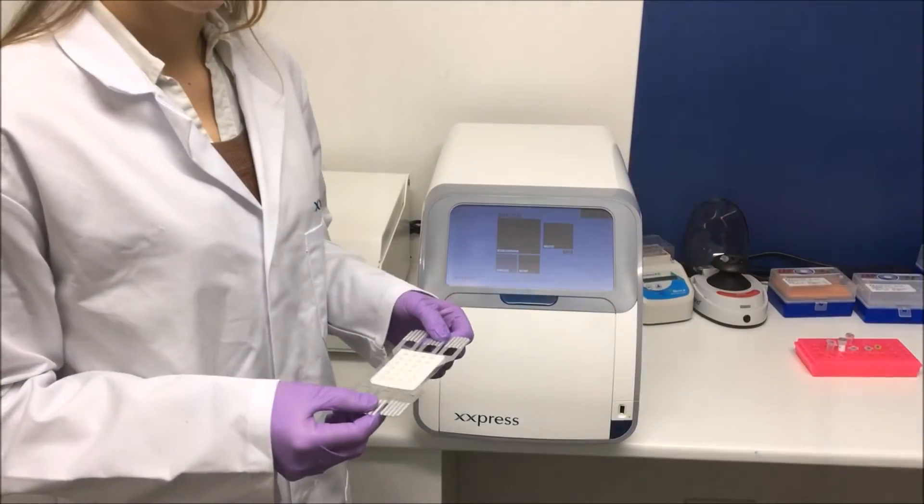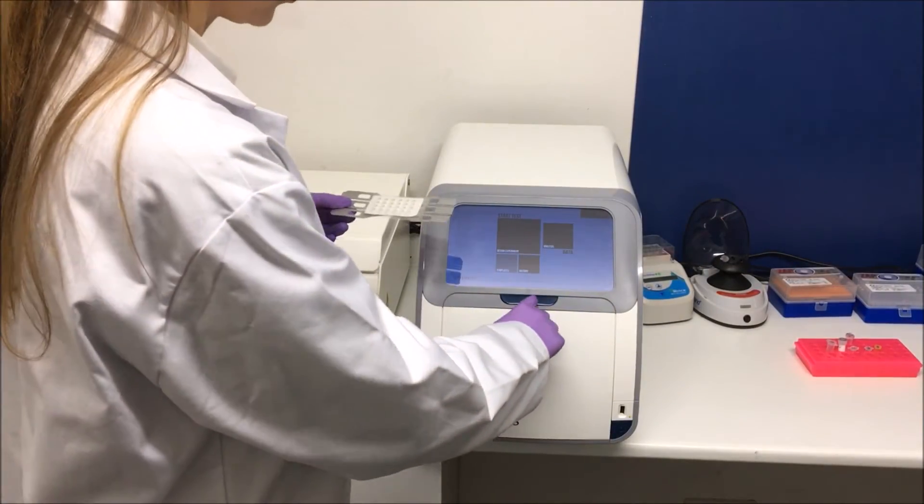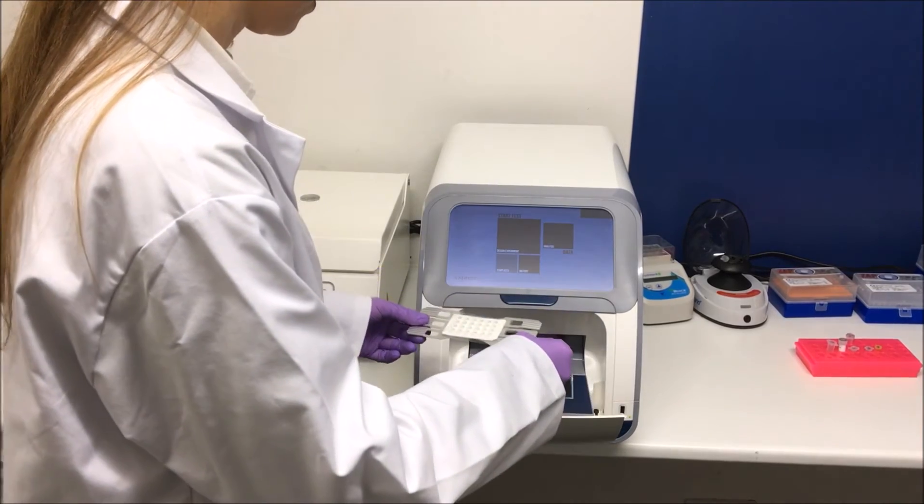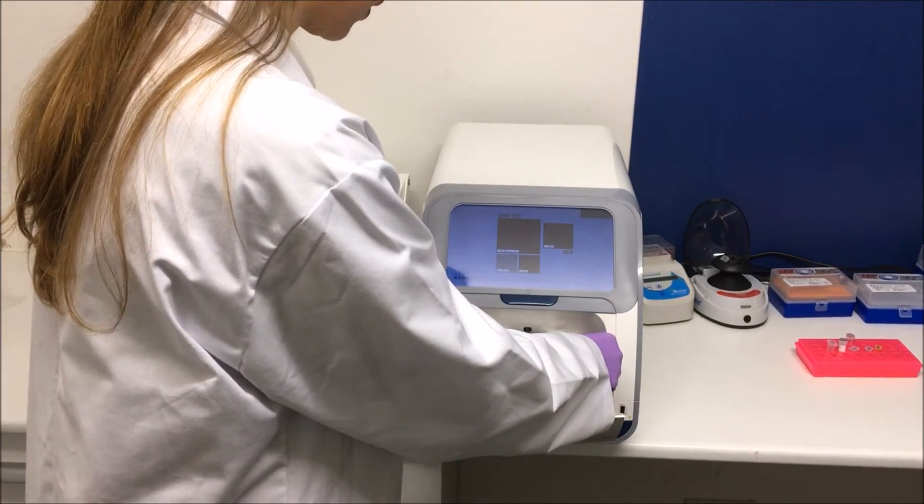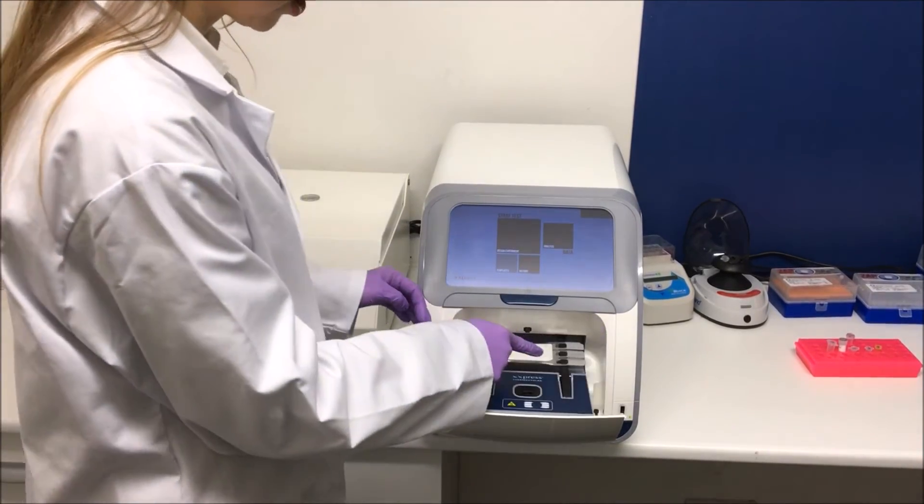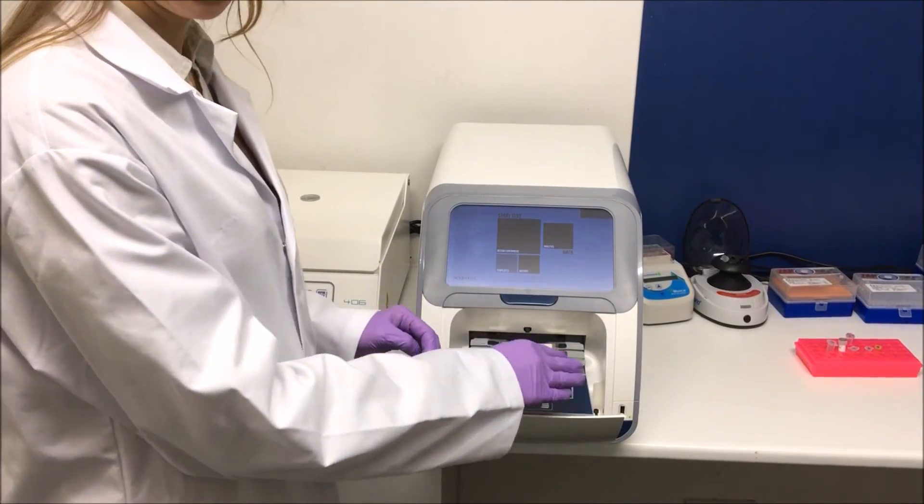Now I place my X-plate into the Express. I open the door using this button here and place the plate onto the locating pins making sure that the cut-off corner is in the bottom right hand side.